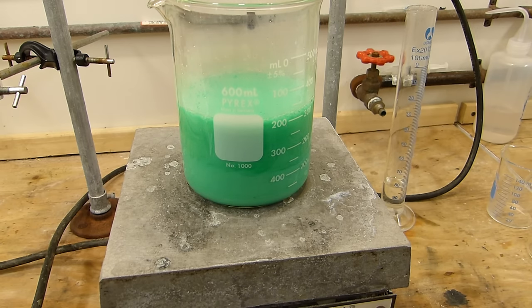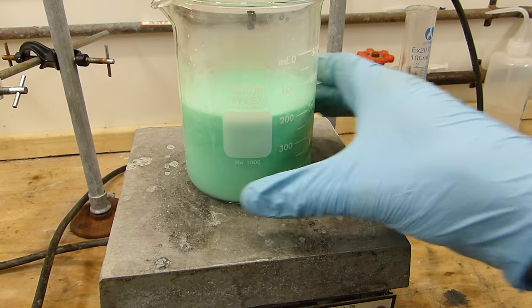You can see there the pretty dramatic change in opacity. I'm going to up the stirring. Keep everything suspended.